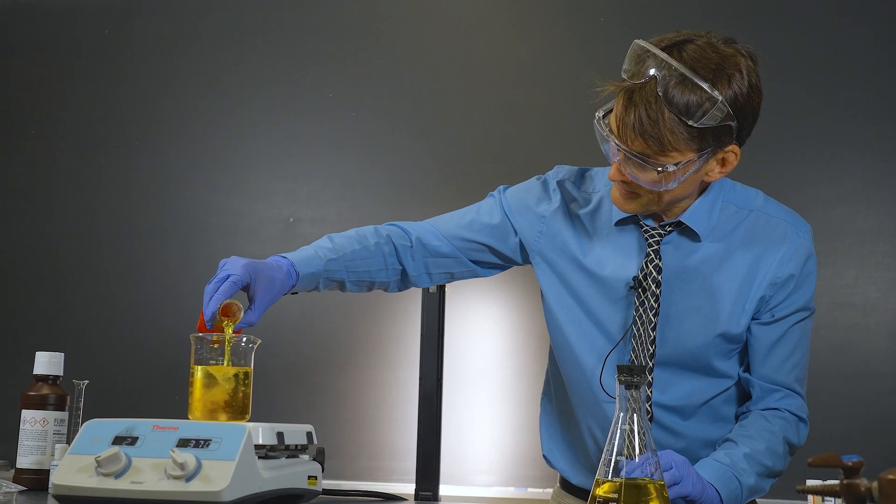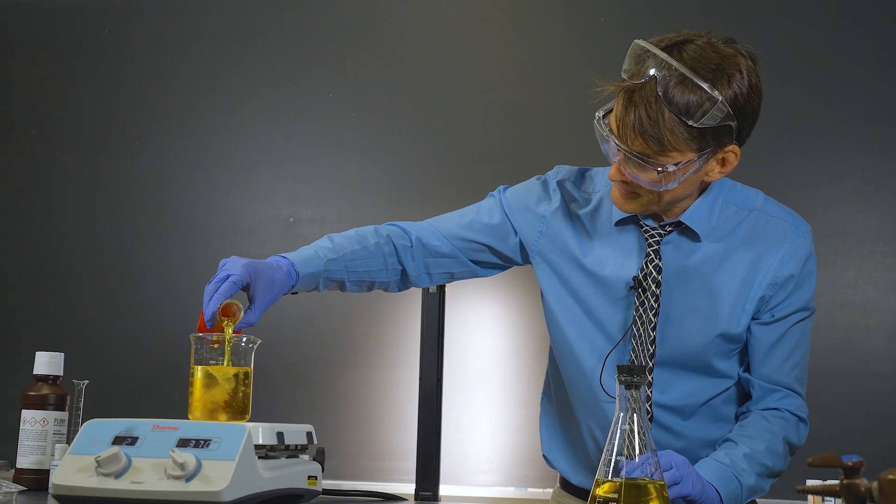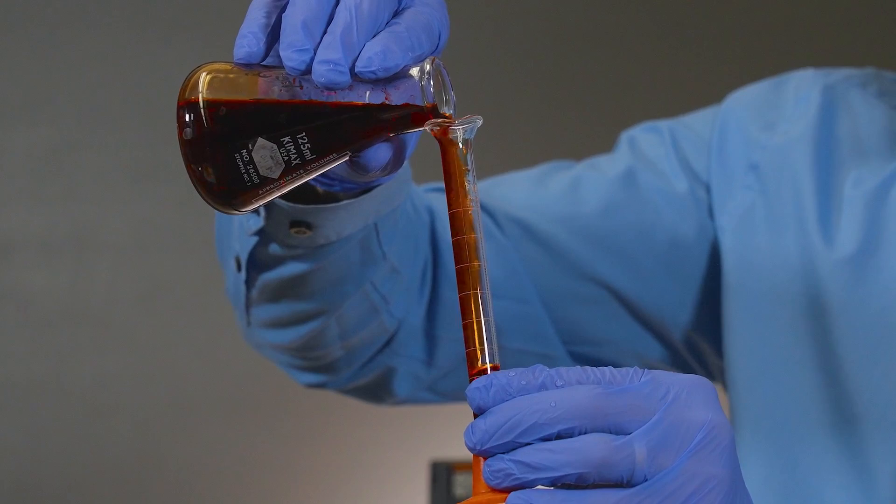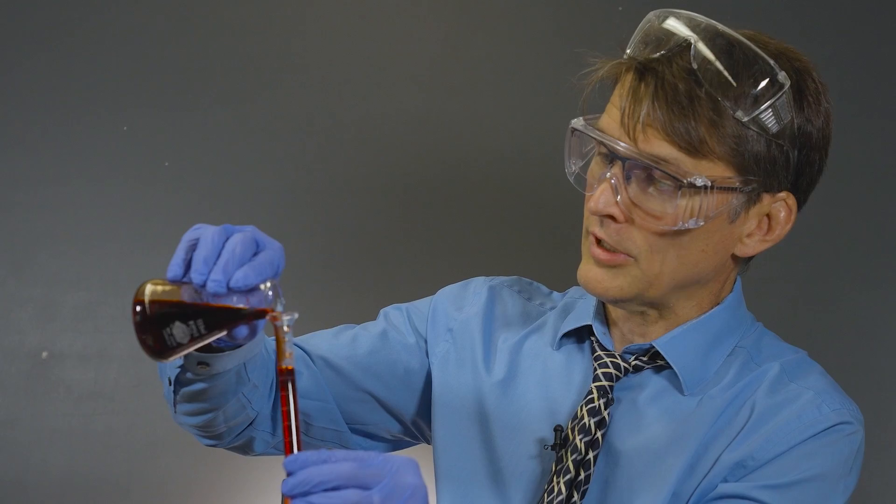And this is the iron solution, which is going to fluctuate between red and blue. And the various combinations of red, blue, colorless, and yellow give us a whole host of colors when the concentrations of these ions fluctuate. Let's hope for the best.